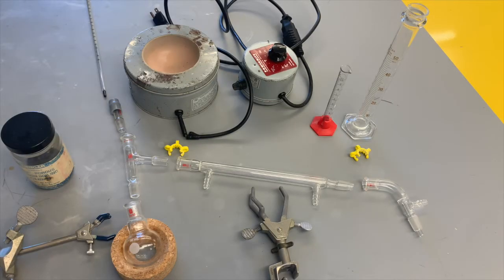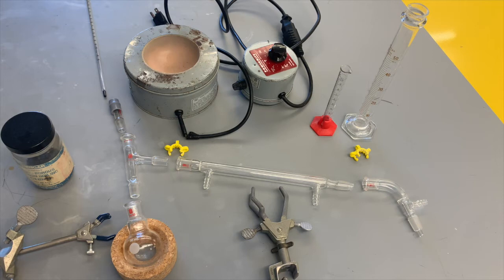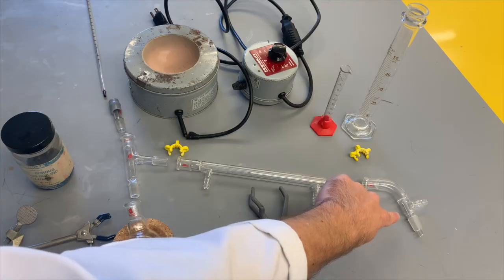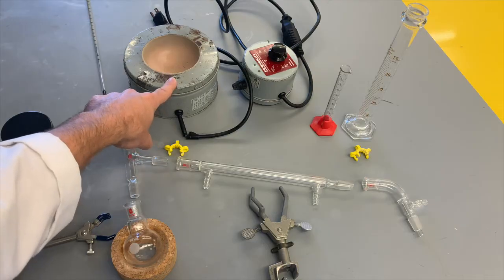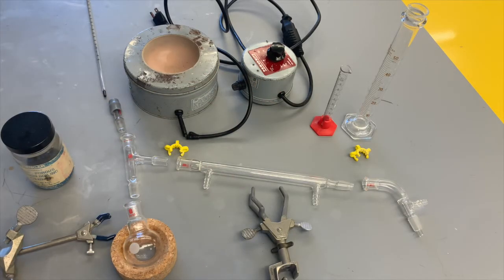There's a French term that chefs will be well aware of called mise en place, everything in its place. Before you begin cooking a meal, you should have all of your cookware ready to go, all of your ingredients ready to go, out and easily accessible before you begin. We should do the same thing whenever we set up an experiment. Here is all of the material that we're going to need for today's experiment. We have a 50 milliliter round bottom flask, a 3-way adapter, a thermometer adapter, a thermometer, a condenser, a vacuum adapter, and then a 50 milliliter graduated cylinder, 10 milliliter graduated cylinder. That's the glassware. We will also need a small clamp, a larger clamp, some boiling chips, and then finally our heat source, which is going to be this thermowell right here. And there is an attached variac right there, which will control the power to determine how much heat is provided to the system.